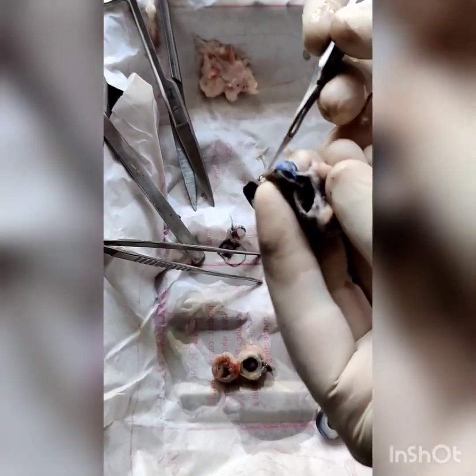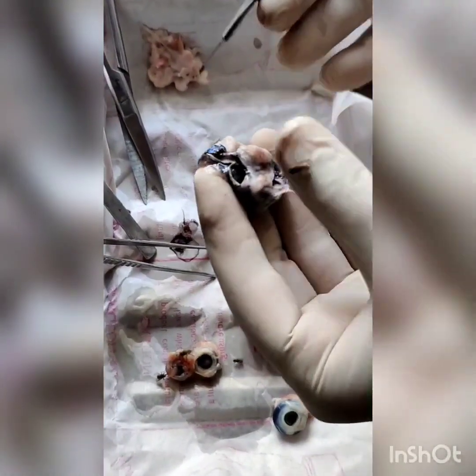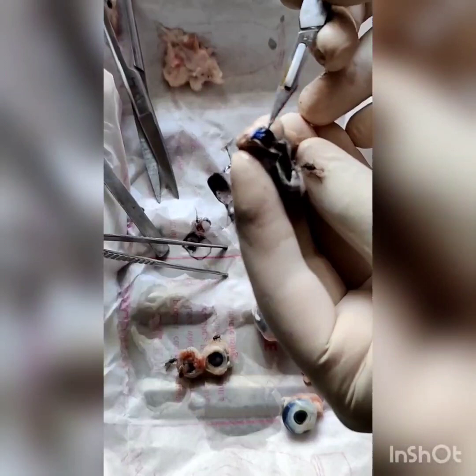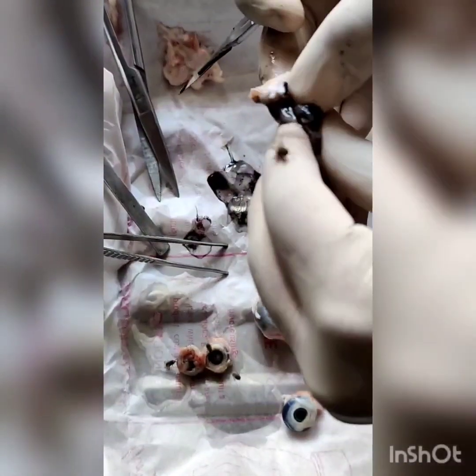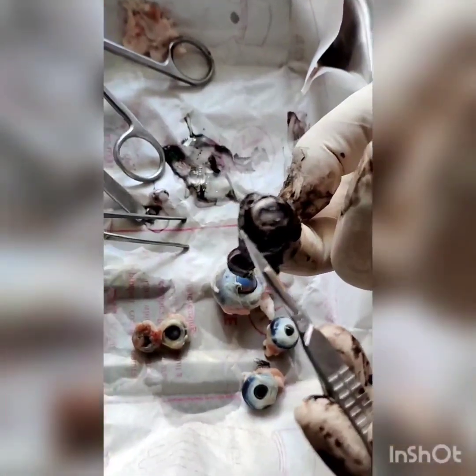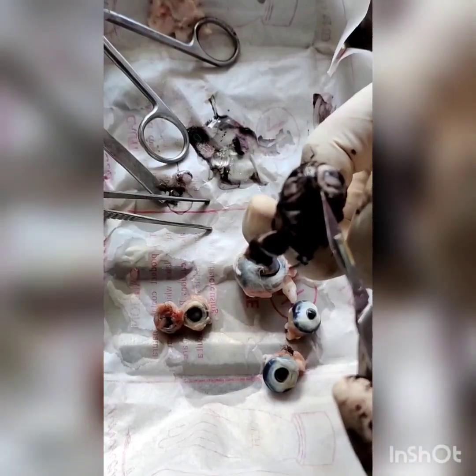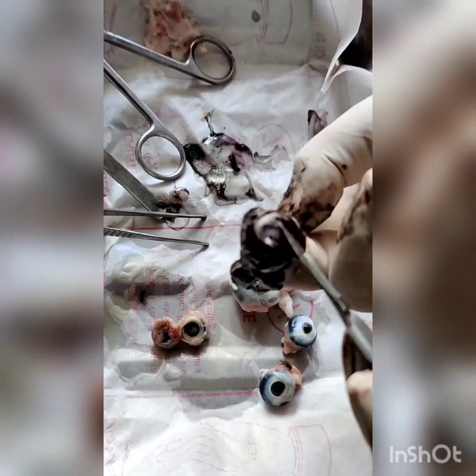The bluish-colored part here is the tapetum lucidum — this makes the animal able to have visibility at night. The outer part visible here is the sclera, and behind that all the blackish layer is known as choroid. Inside the choroid, in the center, is the lens, and these rays you are seeing here.